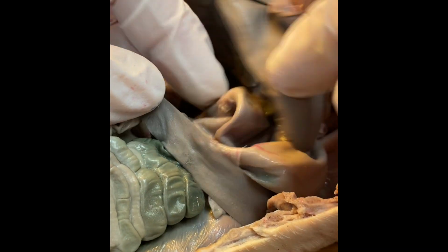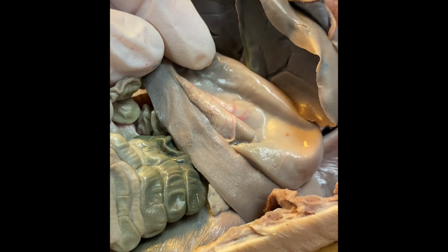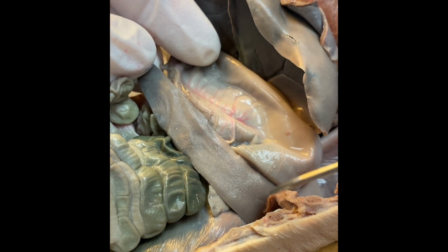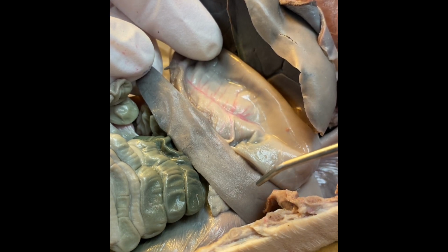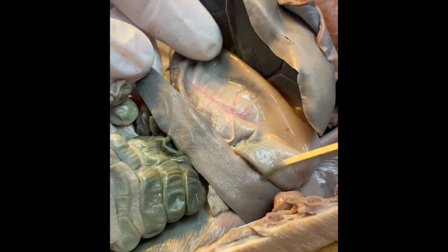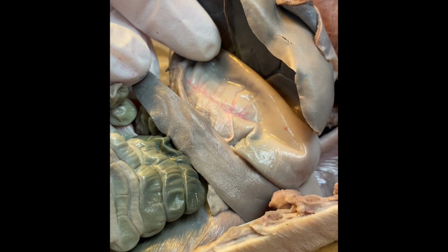This structure that is actually kind of wrapping around the stomach is called the spleen. The spleen is sometimes referred to as the blood cell graveyard. This is actually where red blood cells get stored, and this is also where they get broken down after they have worked so hard that they're ready to be broken down into their parts and be built into new blood cells.